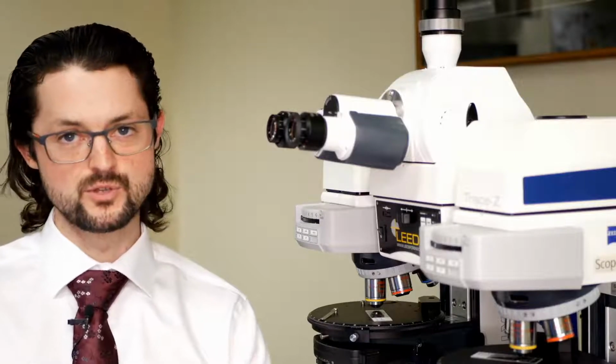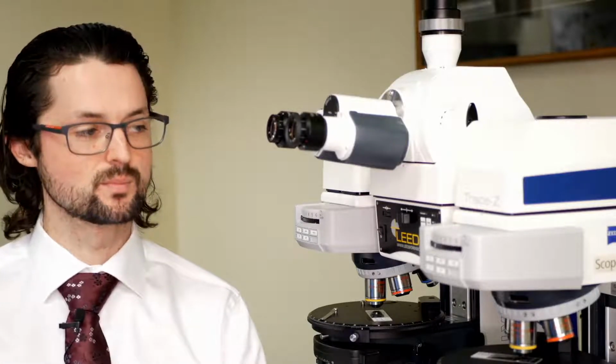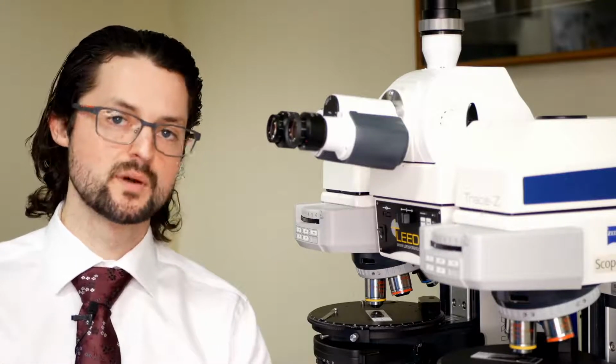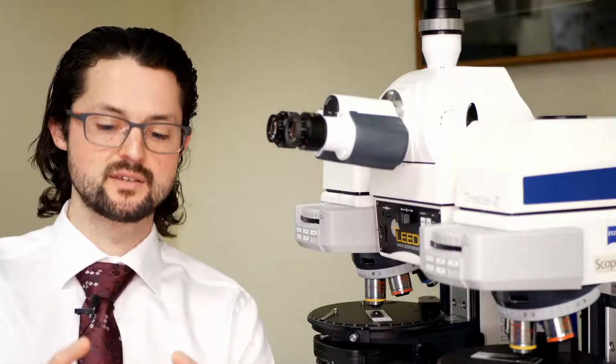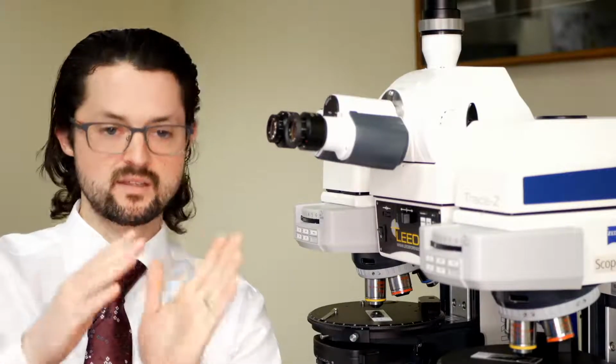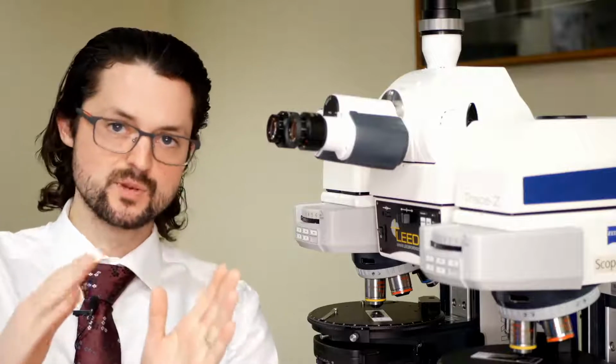There are some other things that we do when we add reflected light Brightfield and reflected light pole to a system. One of the big ones is that polarizers these days are essentially stretched plastic that light moves through and goes into phase with.